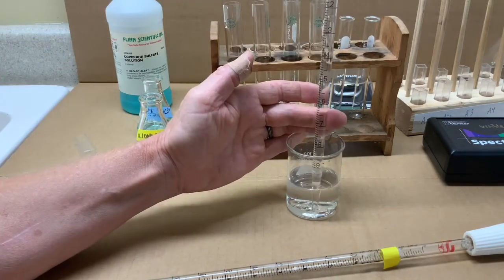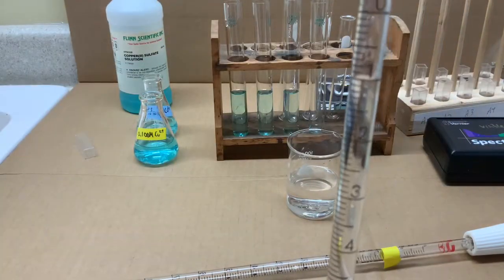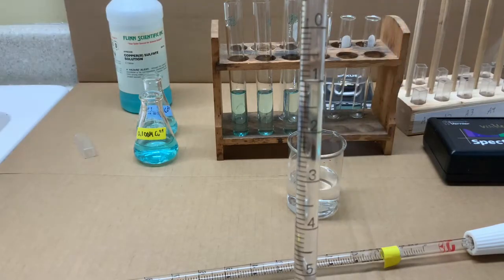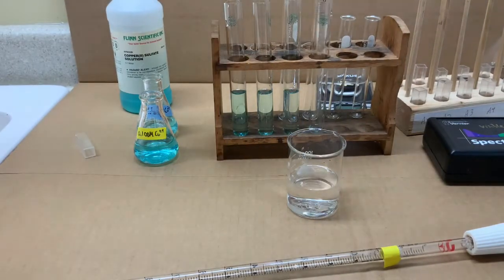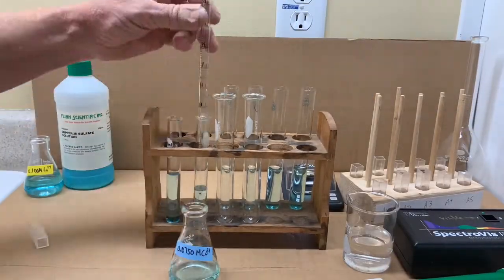And the last one, 9 milliliters drawn all the way up to the 1, which will end up being 9 milliliters of water added to the 1 milliliter of stock solution.